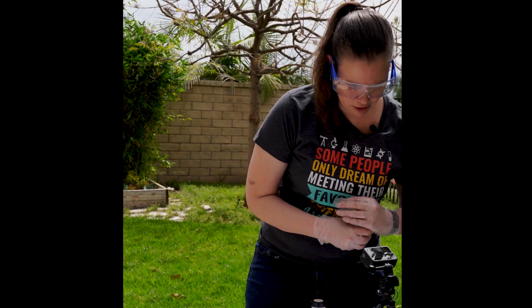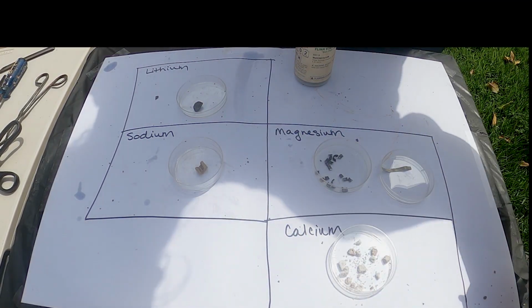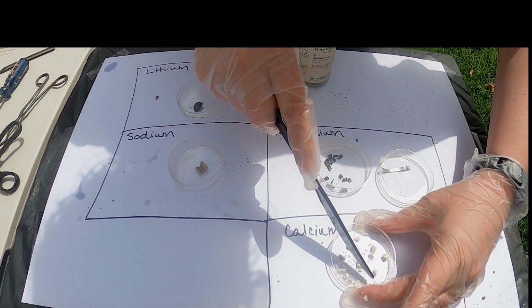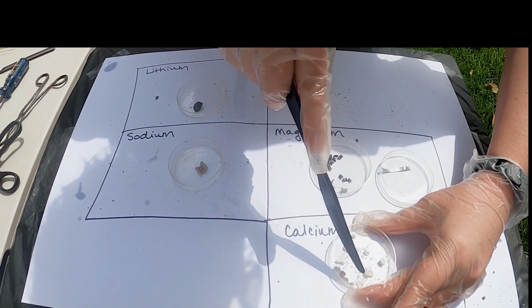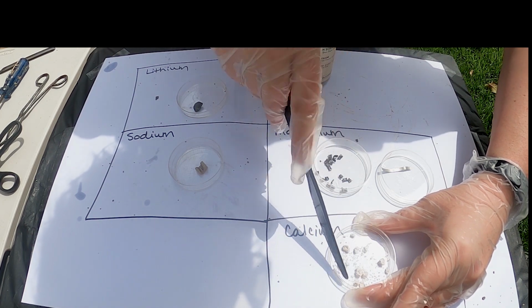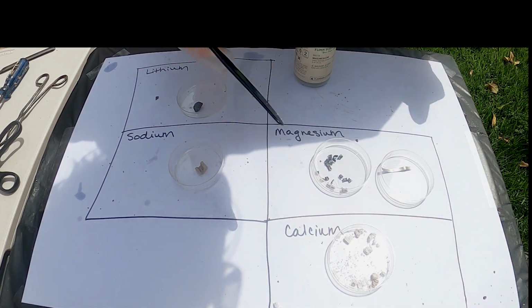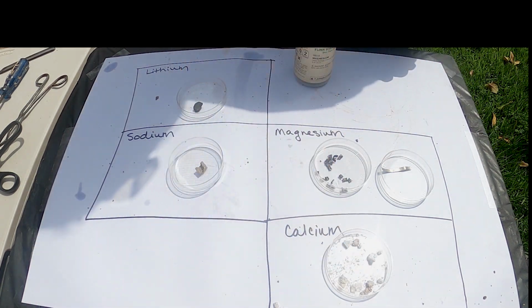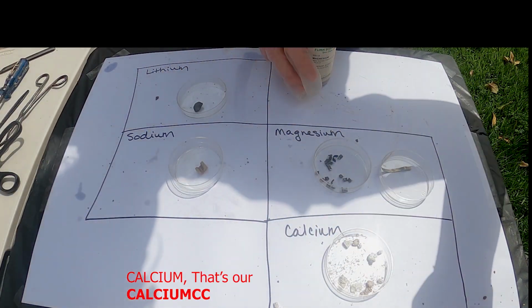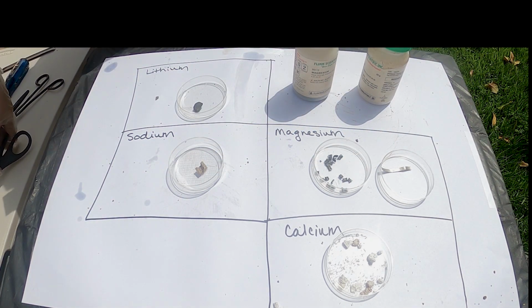All right, let's check out our calcium. So kind of a whitish color. Again, not really cuttable, but you see it breaking into these little tiny pieces. So again, very brittle, but can't really cut it. Very different color, not so shiny. So that's our calcium. Let me put some fresh parafilm back on these guys so we can store them.